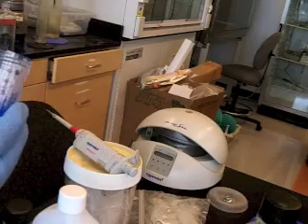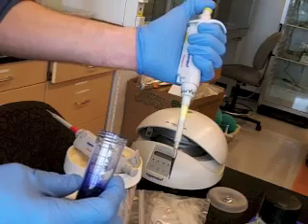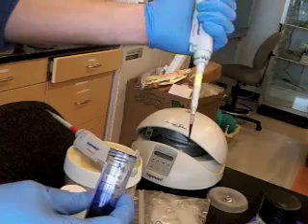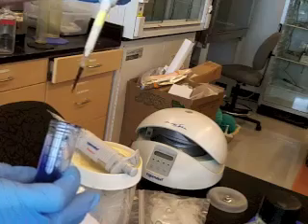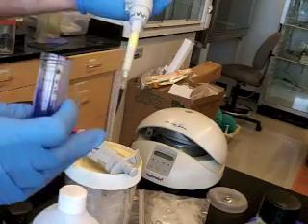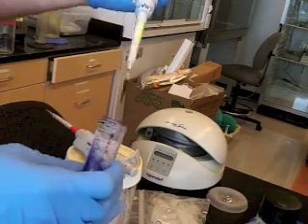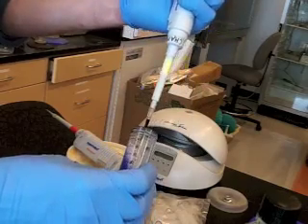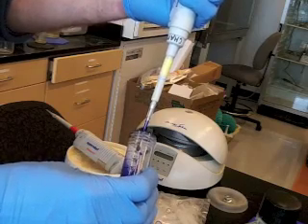Then you want to have the tube that you're going to dispense it into nearby, because as you move things around like this, you're accelerating the tip and the liquid could kind of pull out. Or some liquids don't have just water in them, and they have less surface tension. So some liquids are more sort of drippy. And so it's really good to have the tube that you're going to dispense into, and I'm just going to dispense back into here.